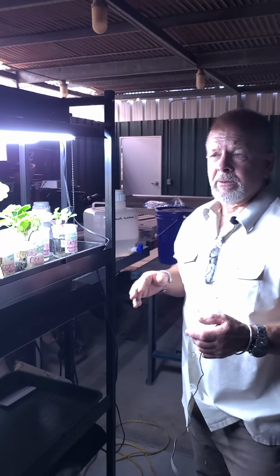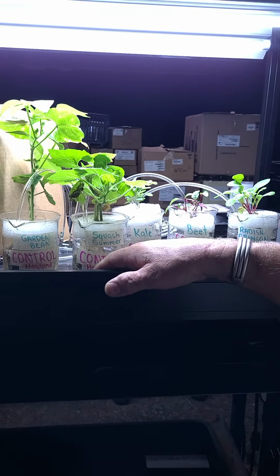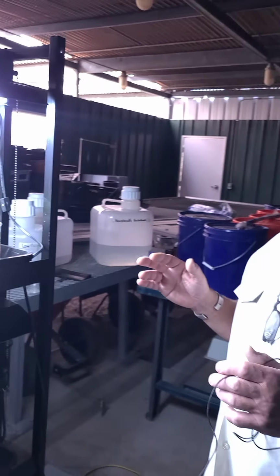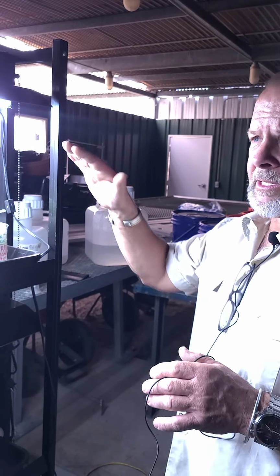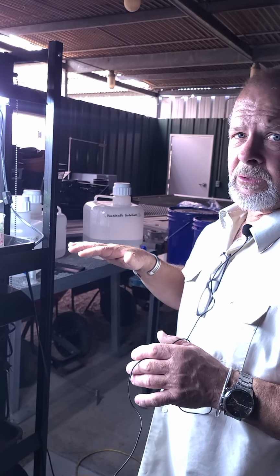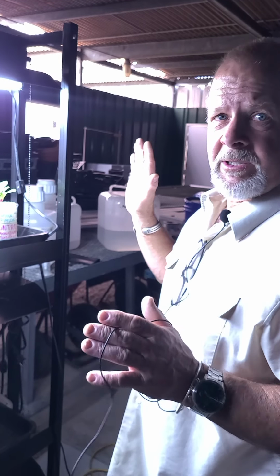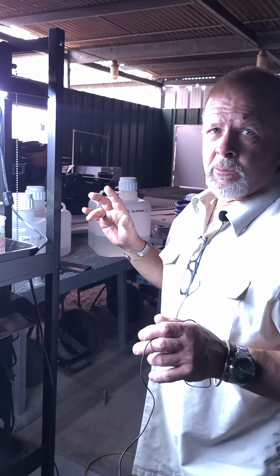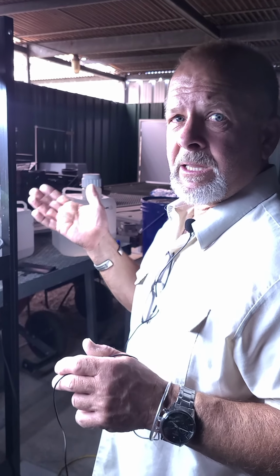So let's come over here and we'll look at our controls first of all, and see how they look. You can see they're pretty well organized. Just to remind you, everything's in a Hoagland solution, which is a total nutrient solution for the plant. So they're lacking for nothing. The only thing that we've tried to make sure is that the solution level doesn't go too low, and that the roots are not out of the water. So everybody so far is very happy with the fact that they've got all the roots in the solution. Let's see if they're happy with what the solution's got in it other than the Hoaglands. Remember that the salinity is the only thing that we've changed.